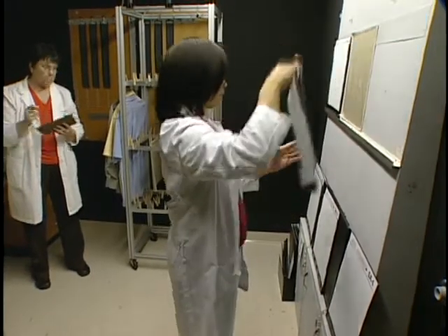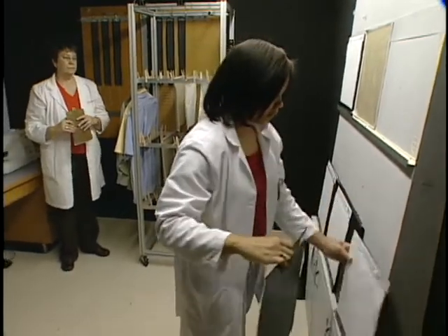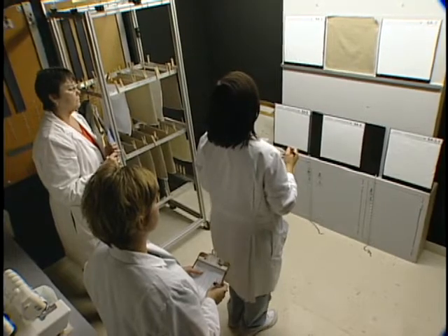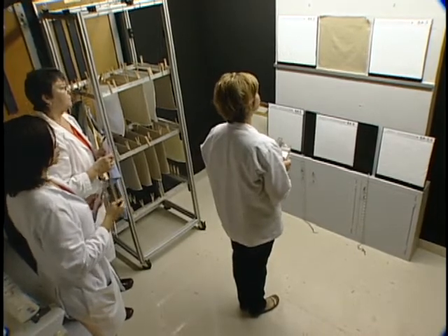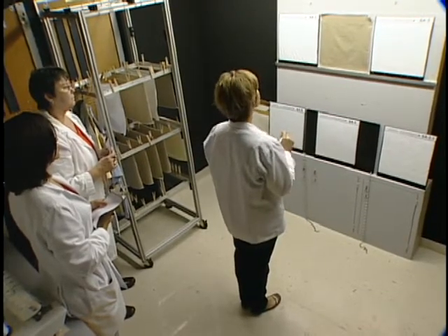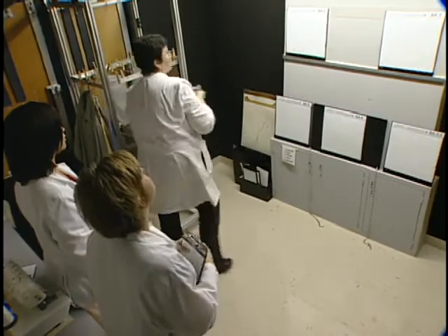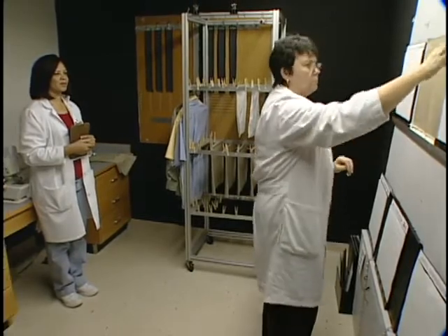Although the 3D smoothness appearance replicas were cast from woven fabrics, it is understood that these wrinkled surfaces do not duplicate all possibilities of fabric surfaces. The replicas are to be used as guides representing various levels of fabric smoothness or freedom from wrinkles. The observer should mentally rate the degree and frequency of wrinkles in the specimen to determine a level of smoothness that can be identified with the replica number which most nearly represents that smoothness appearance level.